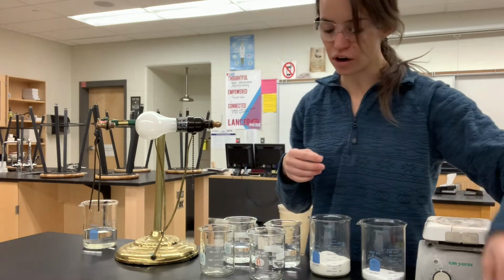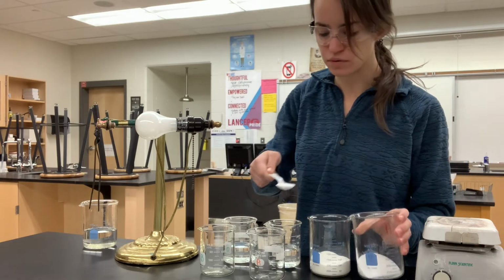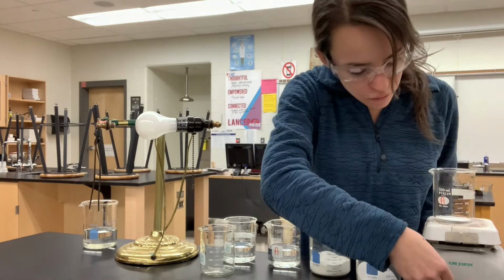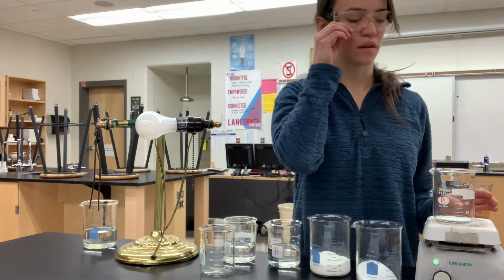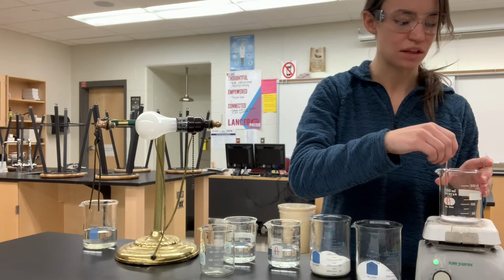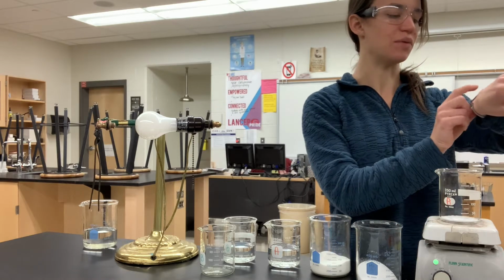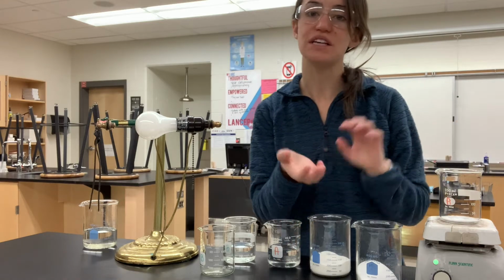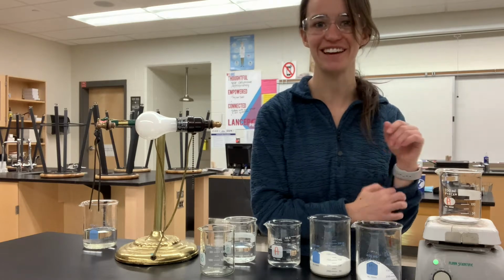So I'm gonna start off with my substance A. I'm gonna put 1 spoonful into my beaker, set it on my hot plate, and turn this on. I'm turning it up to 7 for both of these. I'm gonna continue to stir this and we're gonna look at some visuals throughout it. I'm gonna set a timer for 5 minutes so that we can have some accurate data. Throughout the 5 minutes, I'll show you what it's looking like, and you can write some observations if it's melting or if it's not melting, okay?